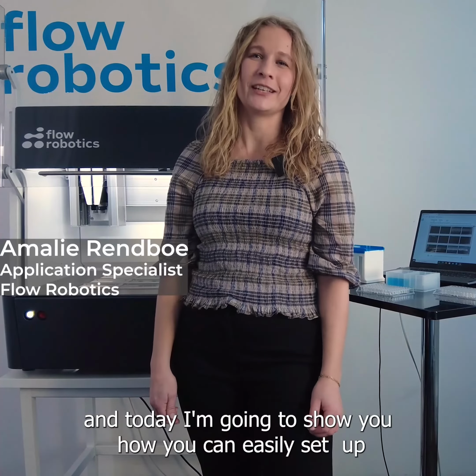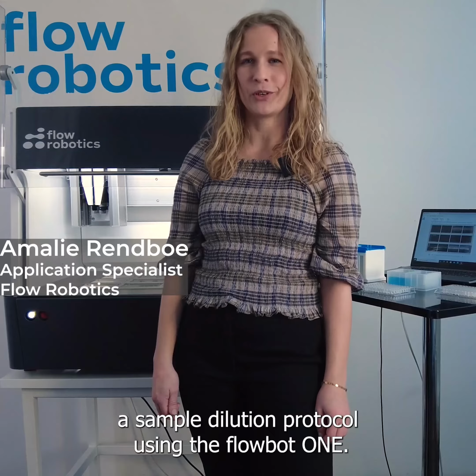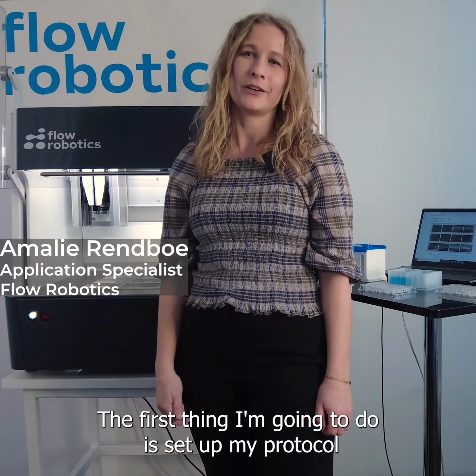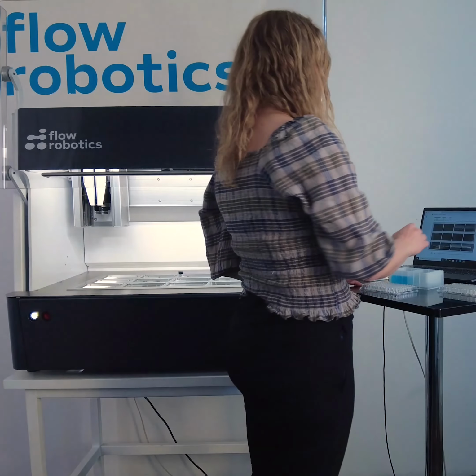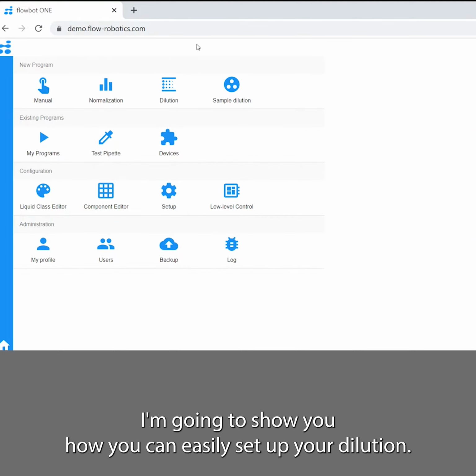Today I'm going to show you how you can easily set up a sample dilution protocol using the flowbot one. The first thing I'm going to do is set up my protocol using the software. Now we're in the software and I'm going to show you how you can easily set up your dilution.